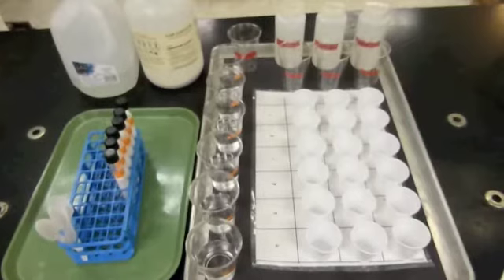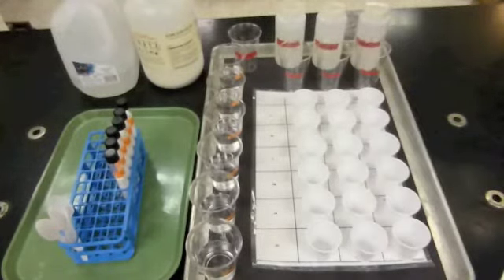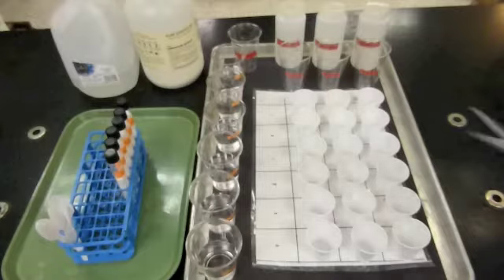And what we're going to do is combine all of those different combinations in cups on a grid, and the grid is laid out the same way as the data table on the back of the first page. So when you're setting up the experiment and taking your data, the way that these cups are arranged is the same as the way the data table is arranged, so you can tell which combinations are being tested in which cup.